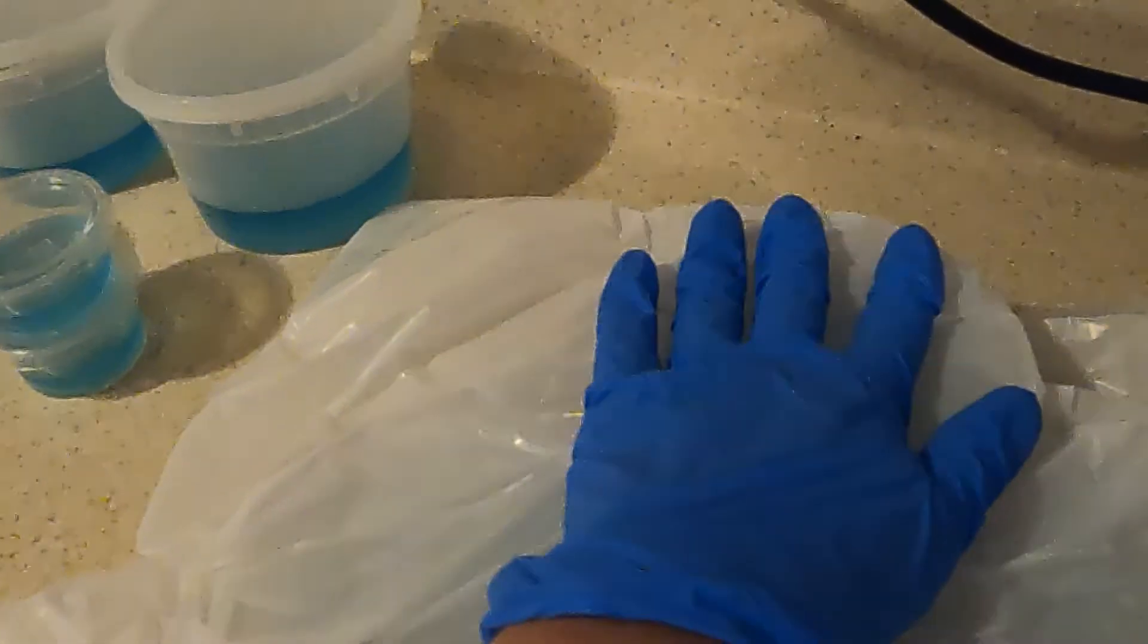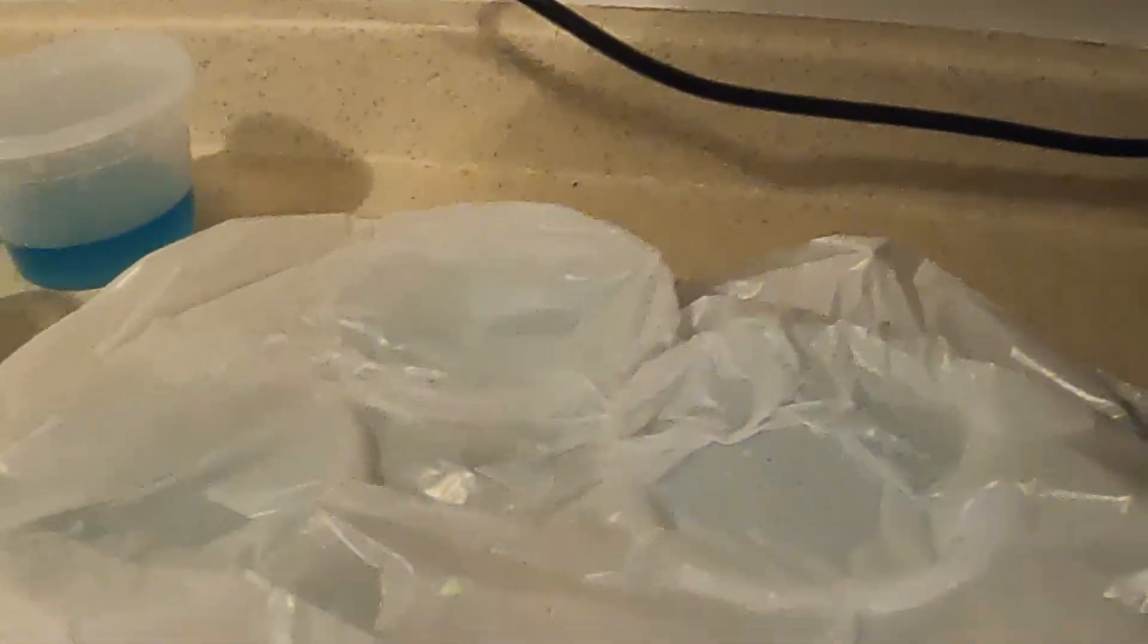Now that it's done 10 minutes I snap down all the lids and I'll remove the media from the bag.